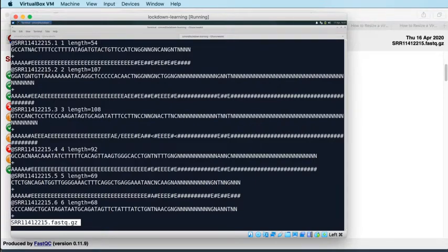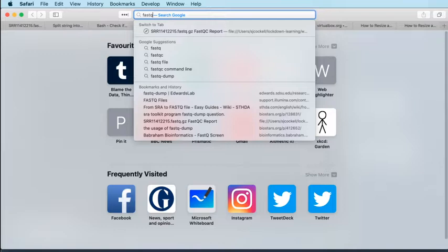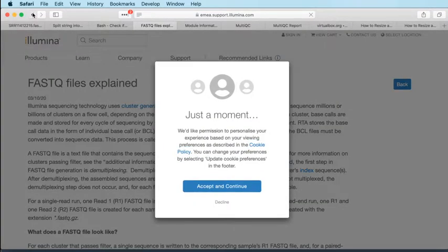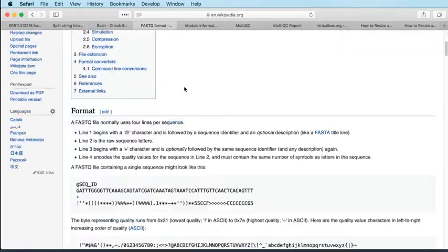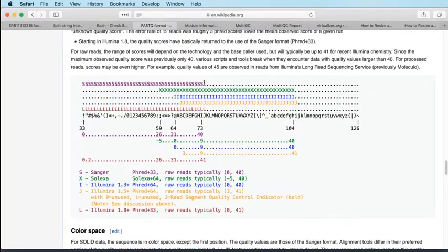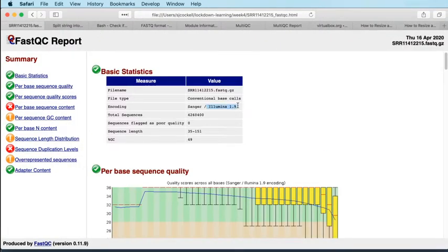So that's why the quality score is only taking particular values, but each of these ASCII values, the A and the hash and the E and the other values that you find, can be interpreted as a numerical value by using a lookup table. The best place to find those lookup tables is the Wikipedia entry for FastQ. If you Google FastQ and jump to the Wikipedia entry, not the Illumina page, the Wikipedia page about FastQ, and scroll down a bit, you will find a lookup table for those quality values. And by finding out which scale we're working off, and if we look at our FastQC report, we can see that we're working off Illumina 1.9 format encoding.